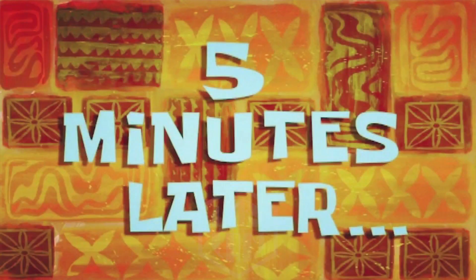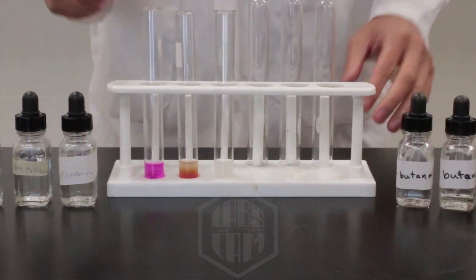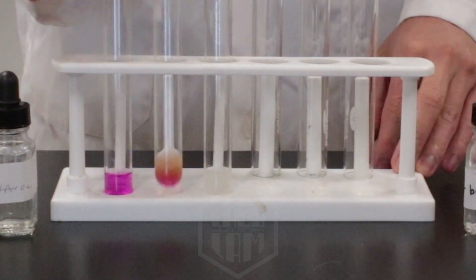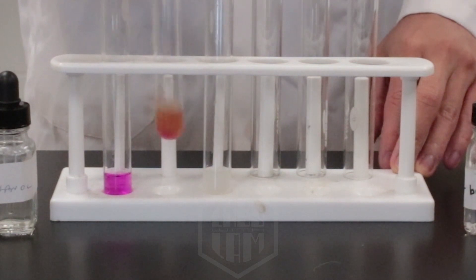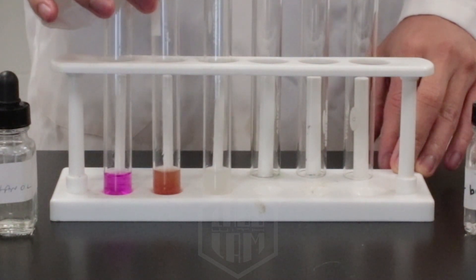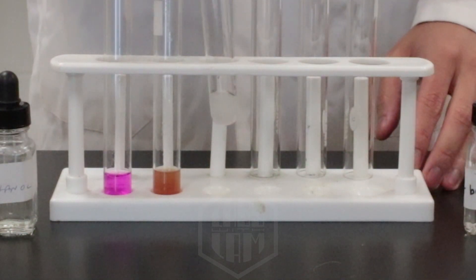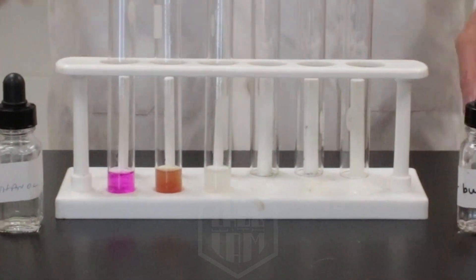Five minutes later. Welcome back. As you can see, our baseline test tube has not reacted at all — still a nice pinkish purple color. We can see that the neutral potassium permanganate has reacted further with the ethanol. We can give that a little bit of a shake. As for the acidified potassium permanganate, there hasn't really been much of a change since the initial reaction. Take a moment to make your observations, and pause if you need to.